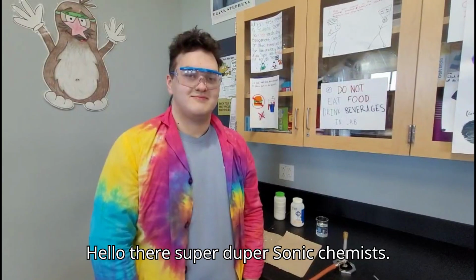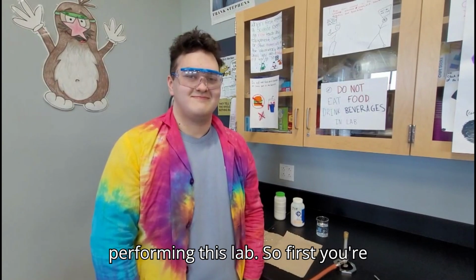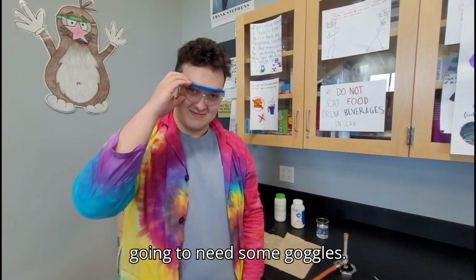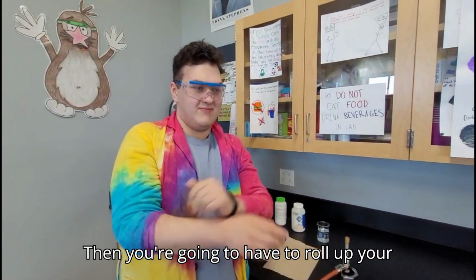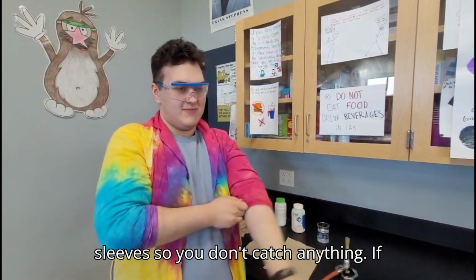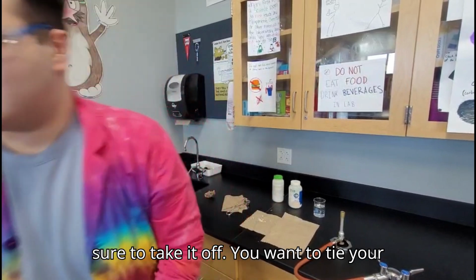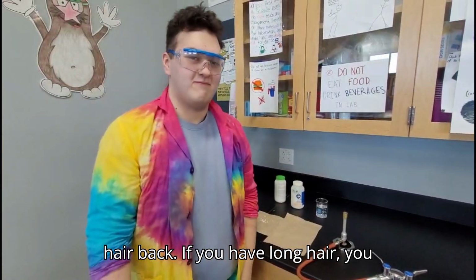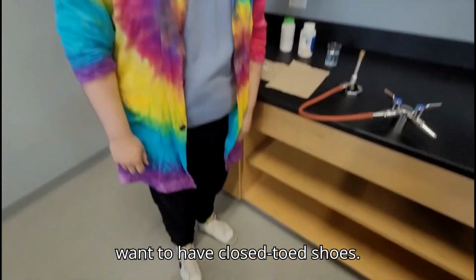Hello there, super duper sonic chemists. I'm here from the voice overlay and I'll be telling you how to be safe when performing this lab. So first, you're gonna need some goggles. Then, you're gonna have to roll up your sleeves so you don't catch anything. If you have any watches or jewelry, make sure to take it off. You wanna tie your hair back if you have long hair. You wanna have closed-toe shoes.